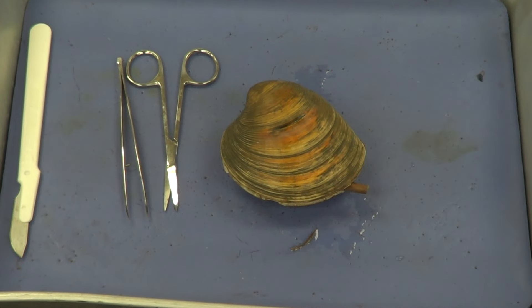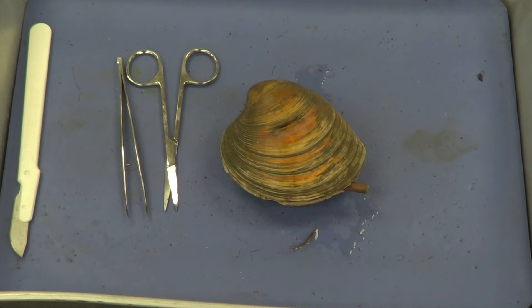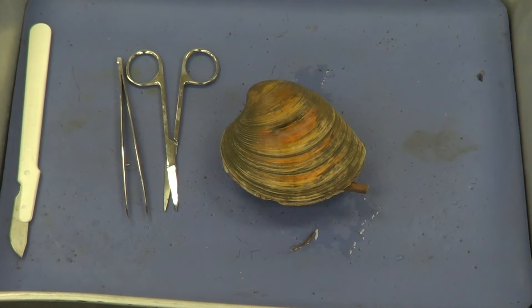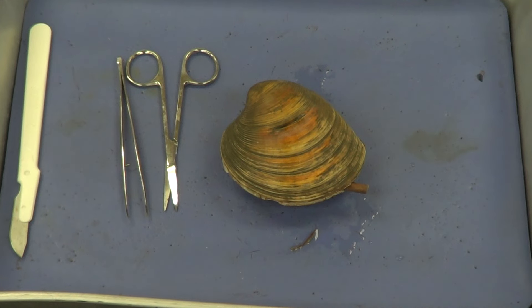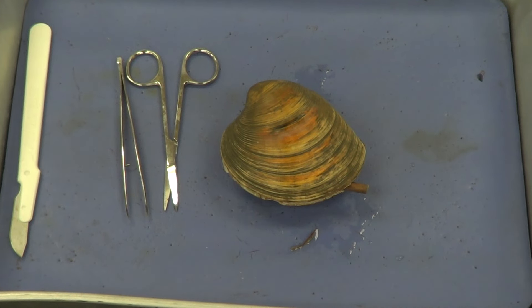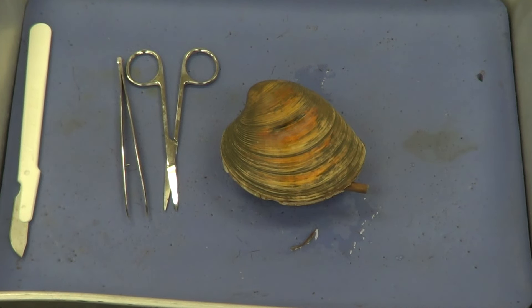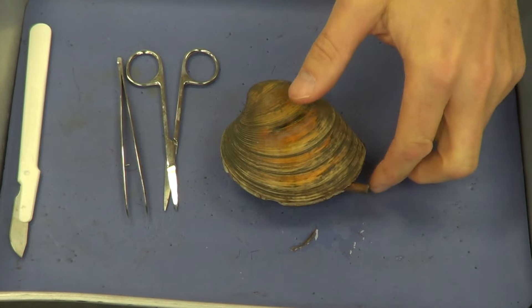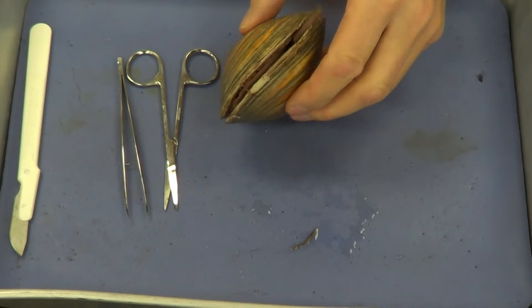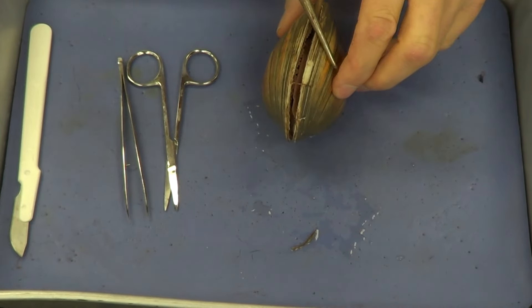Today we're going to dissect the mussel. The mussel is referred to as a bivalve. The reason we call it a bivalve is because 'bi' means two and 'valve' means shell, and our mussel has two shells.